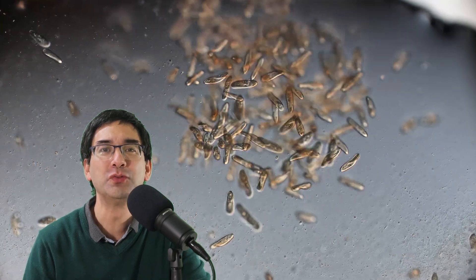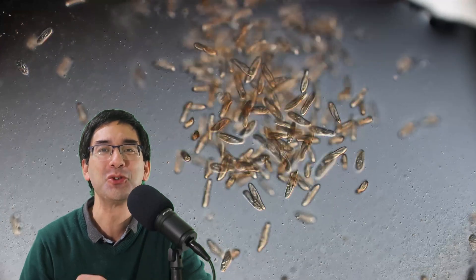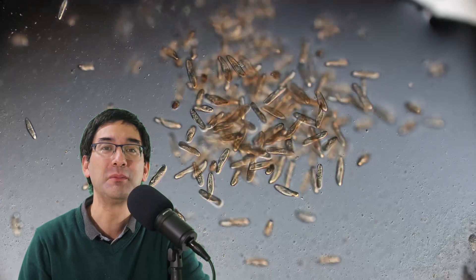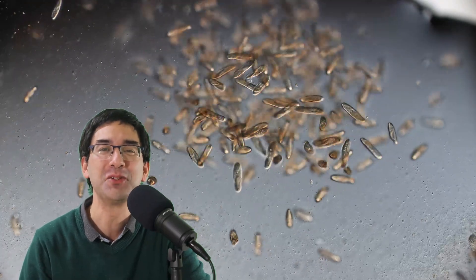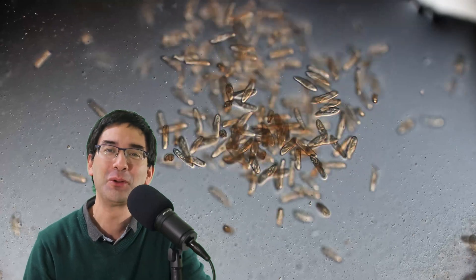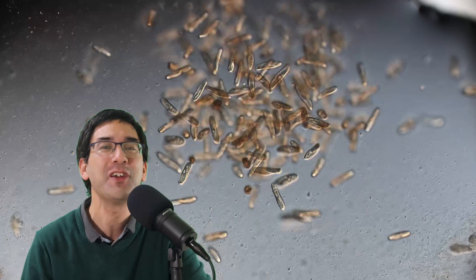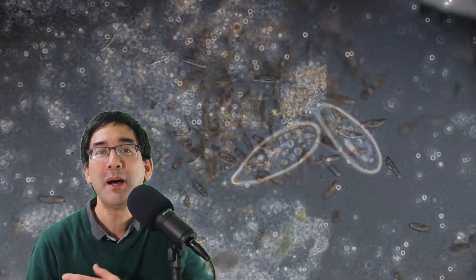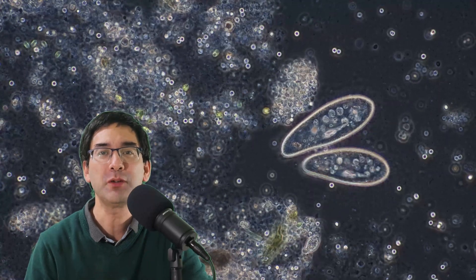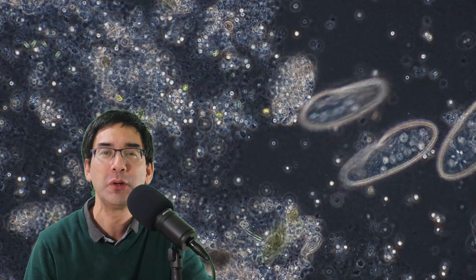In this video I'm going to show you how you can grow thousands of paramecia so that you have plenty of things to observe under the microscope. Later on in the video I'm also going to give you some culturing and observation tips, so you might want to watch until the very end. Now there might be the problem that a water sample you'd like to observe simply does not have enough interesting water life to look at.